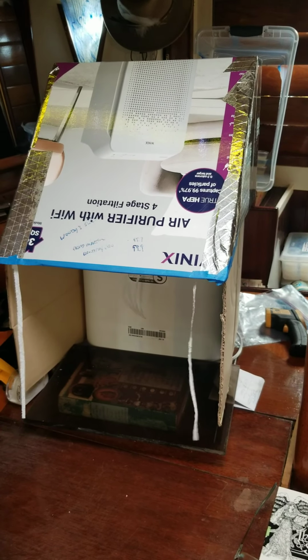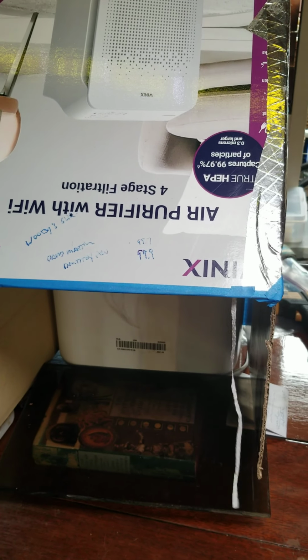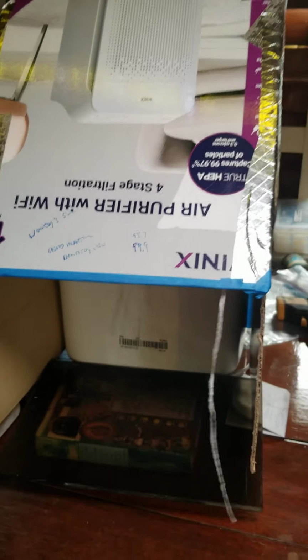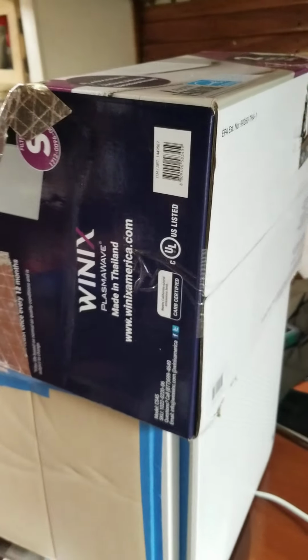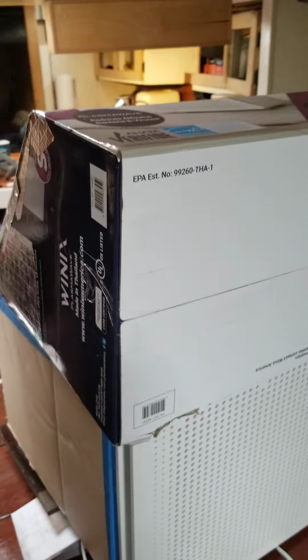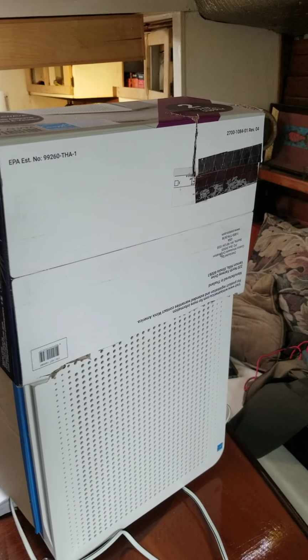Okay, so there it is. This is a Winix air purifier sized for a 360 square foot room. I took the box that it came in, cut it up with a utility knife, and then duct taped it together to create a plenum that will direct the air output downward and over the back, so that I could use it for a mushroom mycology flow hood.